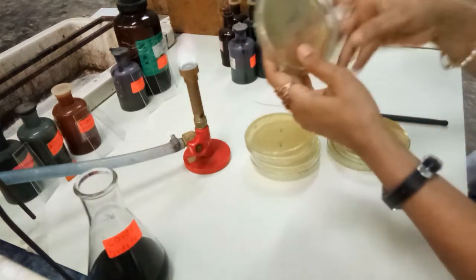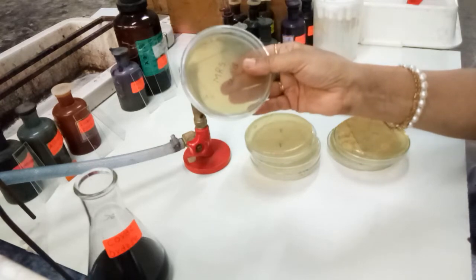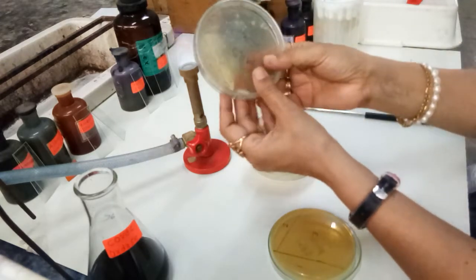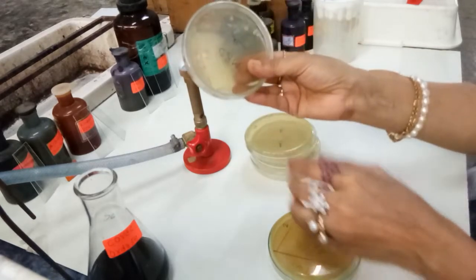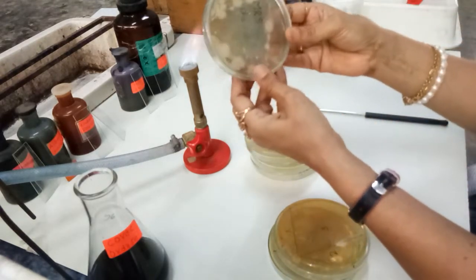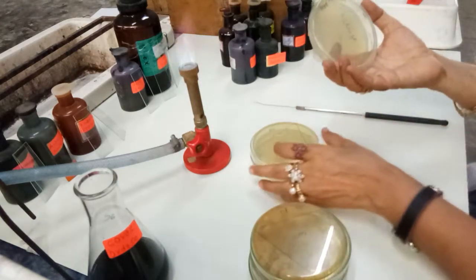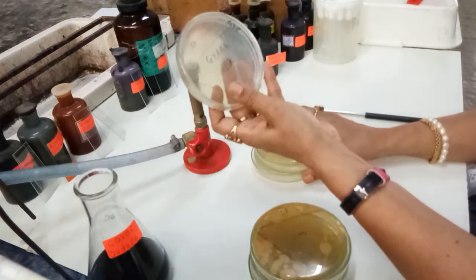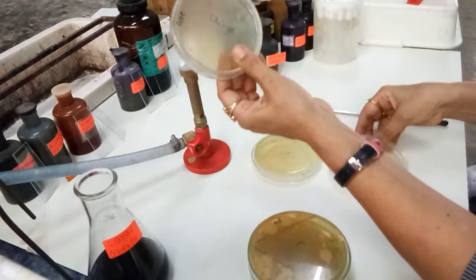In case of MRS plate having curd, we have two separate colonies of lactic acid bacteria. In case of milk, we are getting a nice result, and in the sectors 1, 2 and 3 also we get lactobacillus. In case of cheese, we are getting some little contamination and also the growth of lactic acid bacteria. Okay, and in case of glucose yeast acetic acid agar, the growth is very scanty in all the three different natural samples.